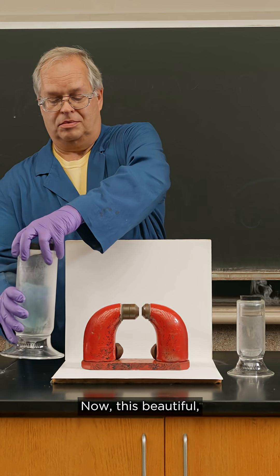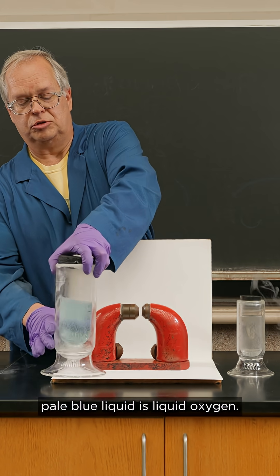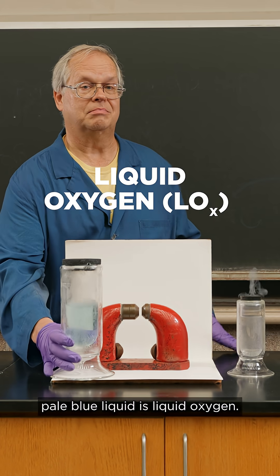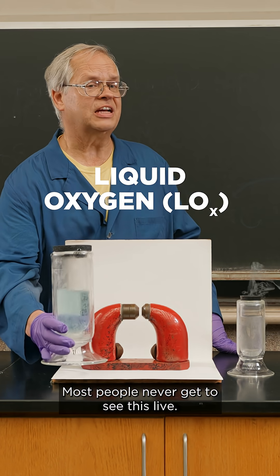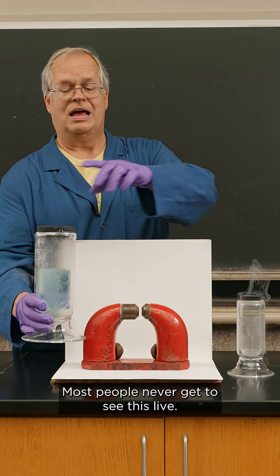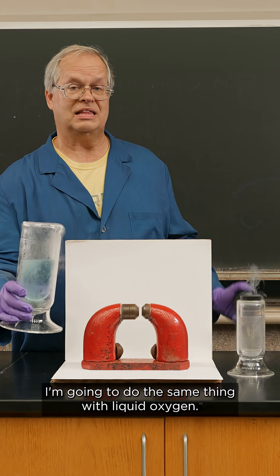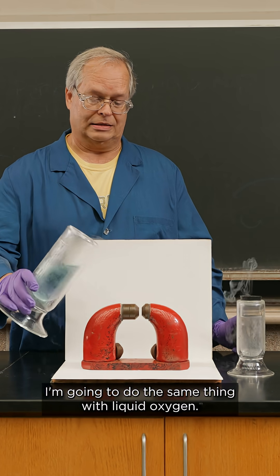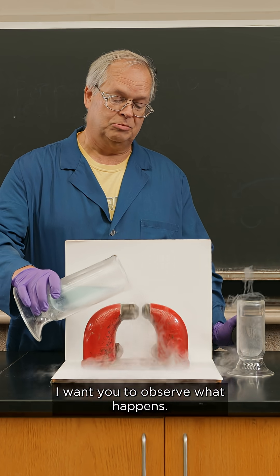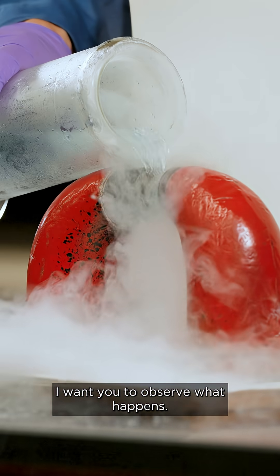Now this beautiful pale blue liquid is liquid oxygen. Most people never get to see this live. I'm going to do the same thing with liquid oxygen. I want you to observe what happens.